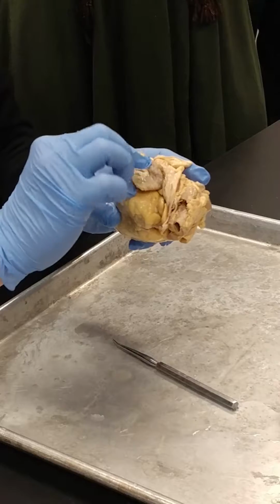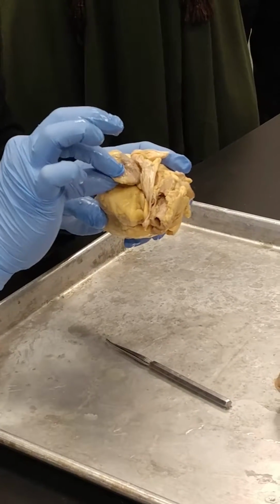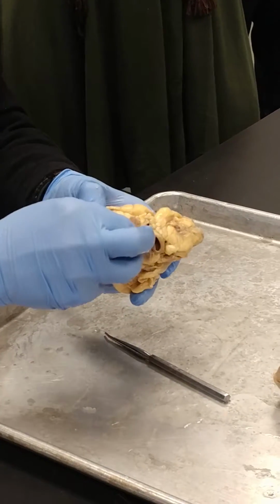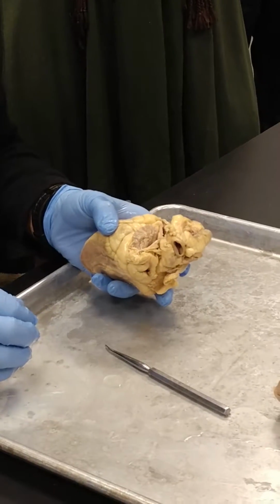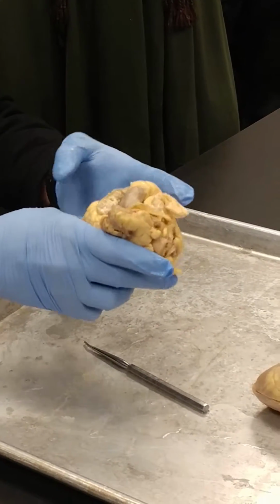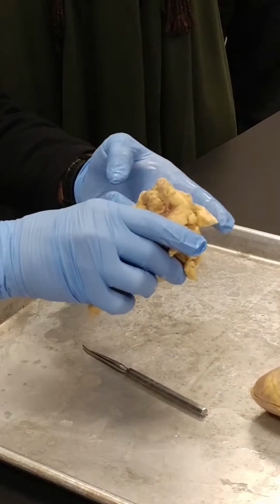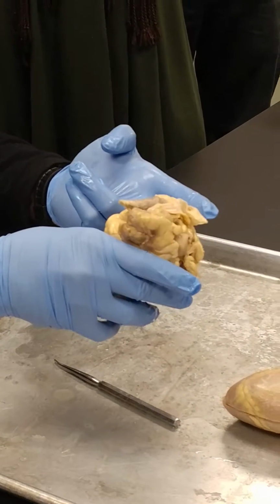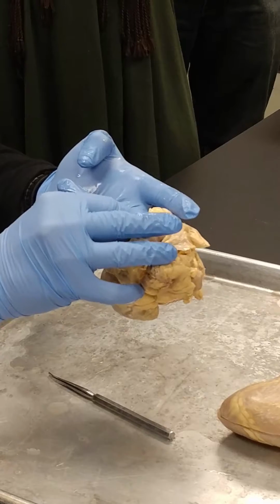So that's an auricle. That's an ear. That looks like an ear, doesn't it? It's an ear flap. So that's one auricle. And then here's the other auricle on the other side. What's the purpose for those? They're like accordions. There's always a question, what's the purpose? But we think they're almost like a little bit of an accordion. They will open up when the atria fill up more with blood, and then they'll collapse more when they're not.